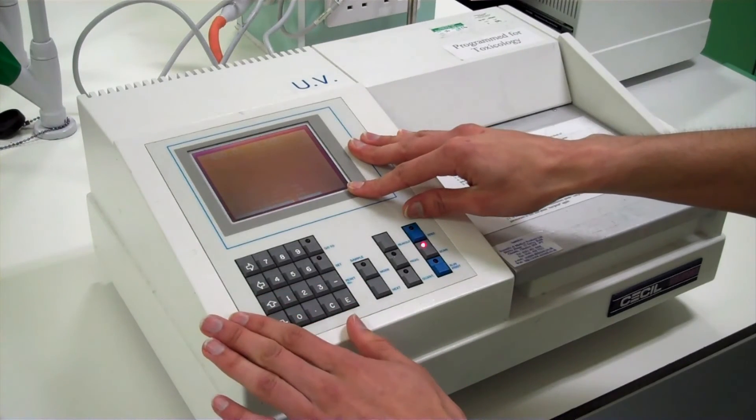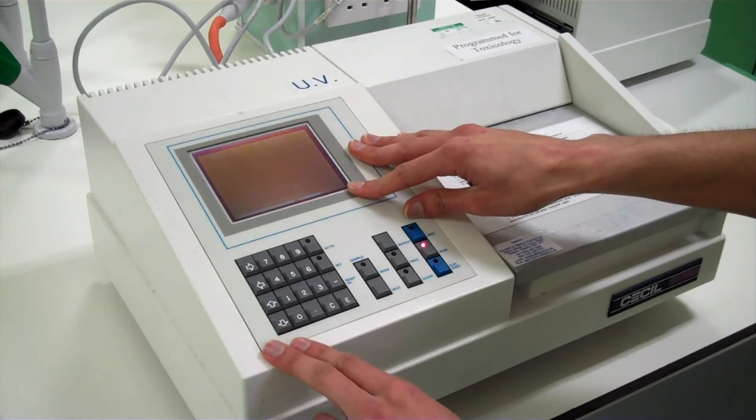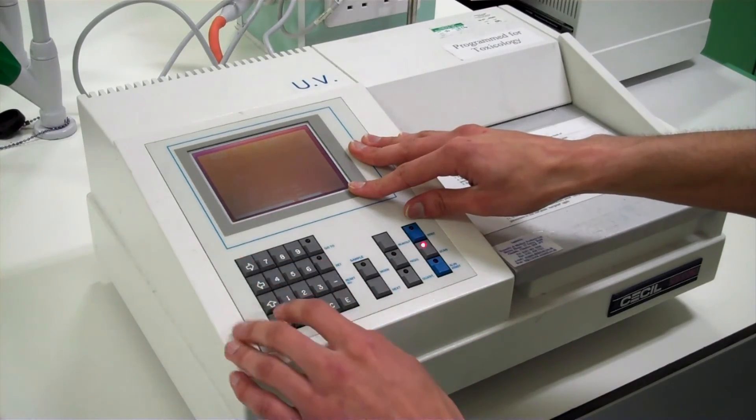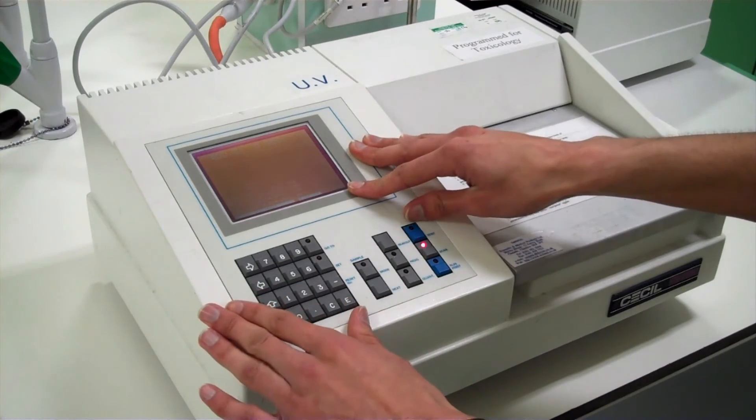Enter. The next parameters are scale. Every centimeter on our absorbance spectrum will represent 25 nanometers. Enter.